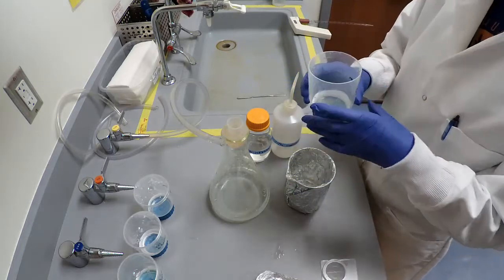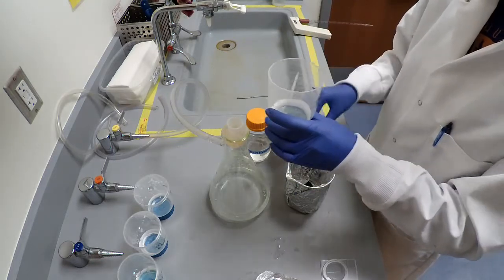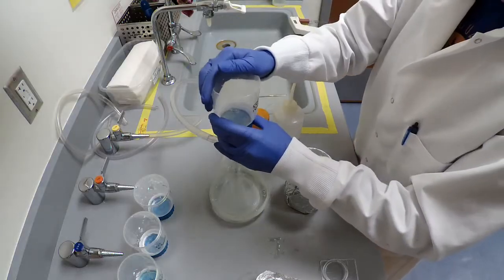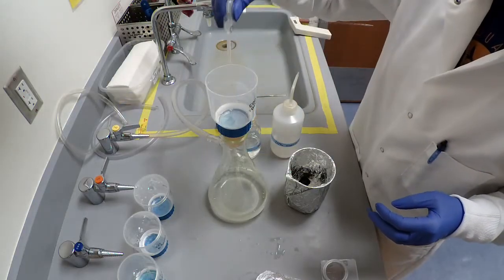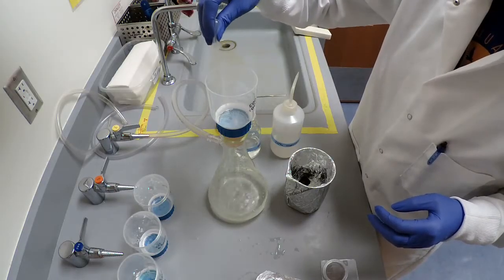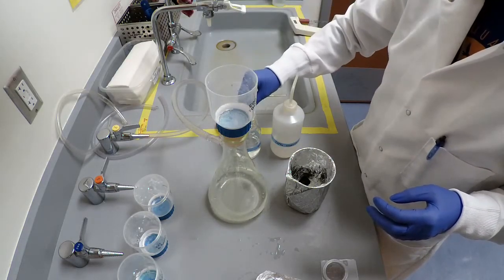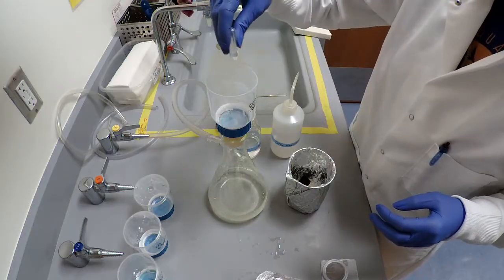Vacuum filter off the Nile red. Wash excess Nile red off of the filter with 5 ml of N-hexane to reduce background fluorescence.